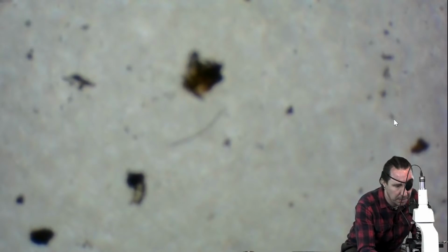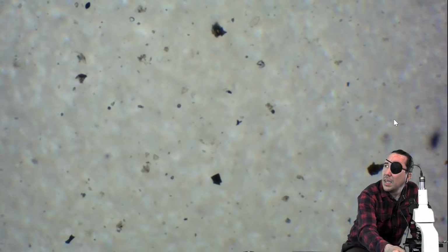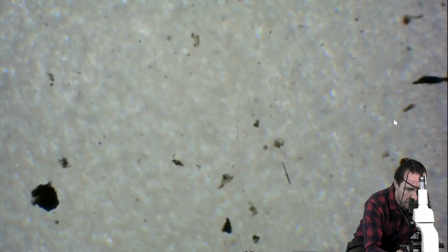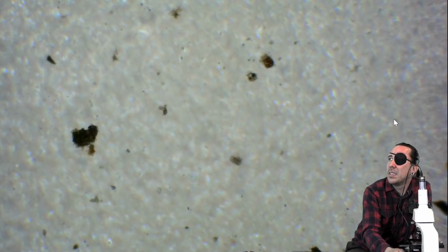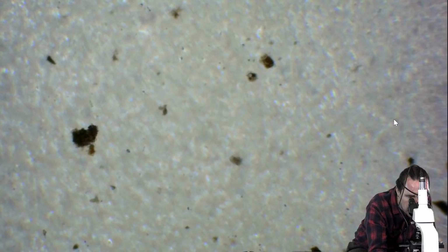Dan had thought that he had seen an oomycete in this sample, so we're going to look for that real quick. I don't know if I have the right corner. Yeah, you can see it on 4. You can zoom way out and see it. Way in the corner? Directly in the corner? It's huge. I'm going to go down to this other corner because I think I may have moved this slide when you handed it to me. Dan had thought he found some of the oomycetes that I was talking about that are pathogenic fungi. The clear, thin diameter fungal strands.